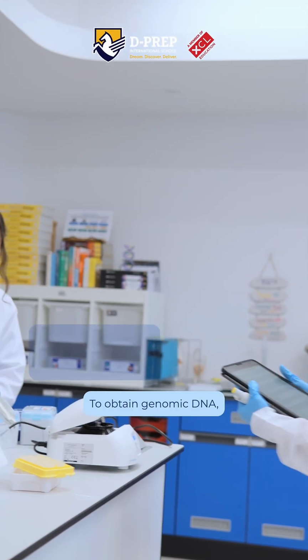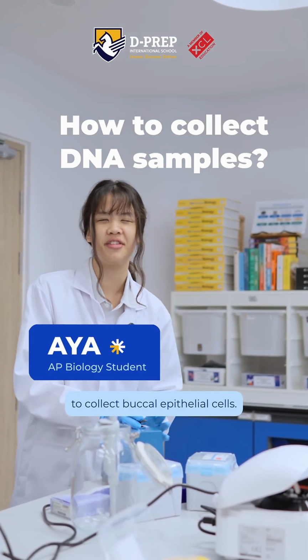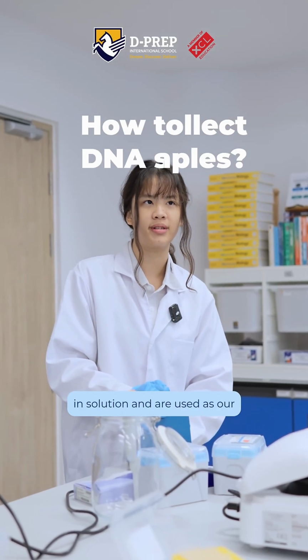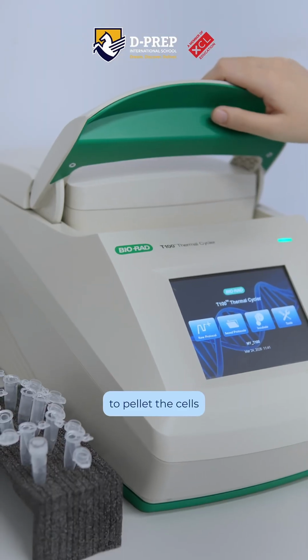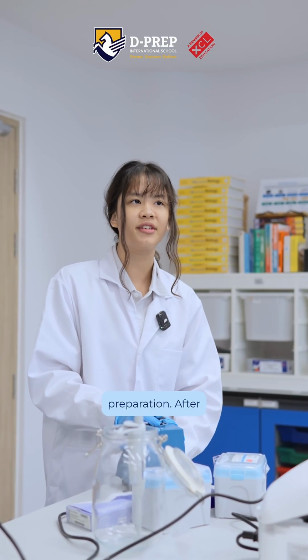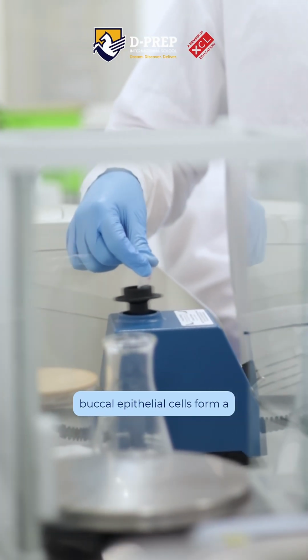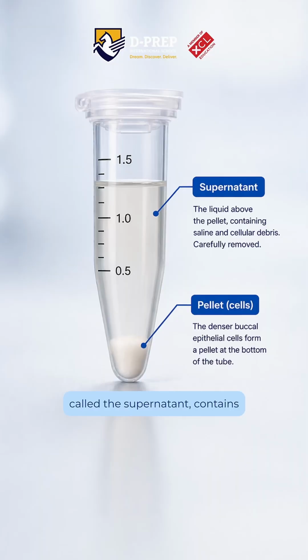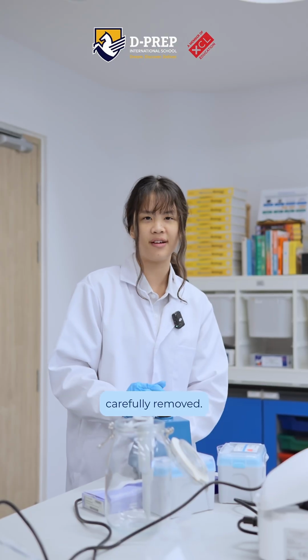To obtain genomic DNA, we perform a saline mouth rinse to collect buccal epithelial cells. These cells are suspended in solution and are used as our DNA source. We then use a centrifuge to pellet the cells, concentrating them for DNA preparation. After centrifugation, the denser buccal epithelial cells form a pellet at the bottom of the tube, while the liquid above, called the supernatant, contains saline and cellular debris and is carefully removed.